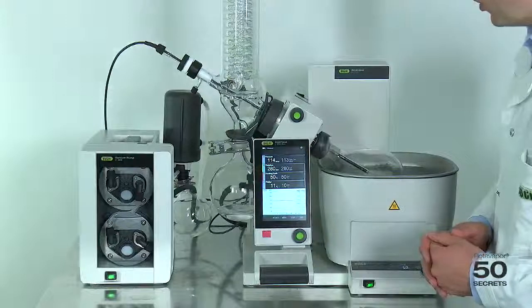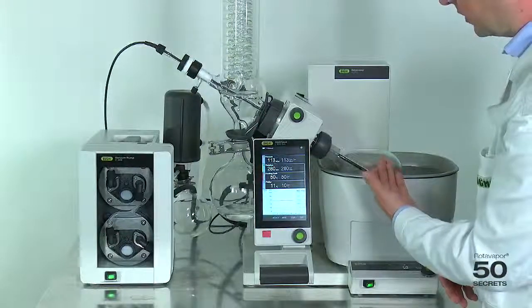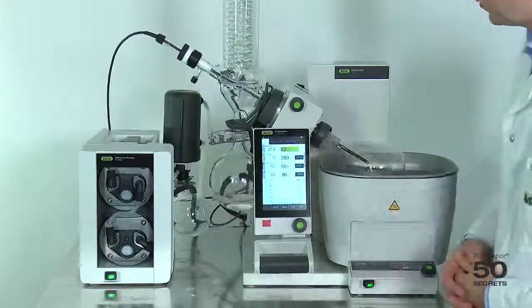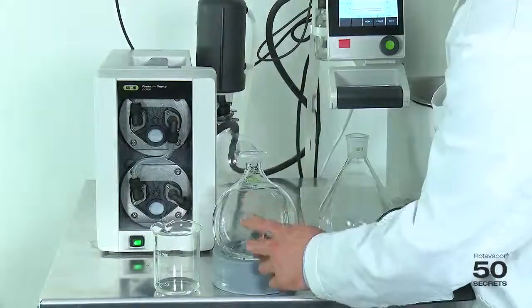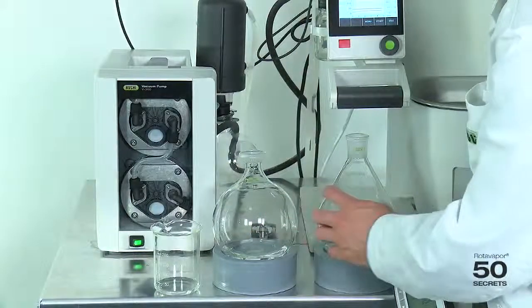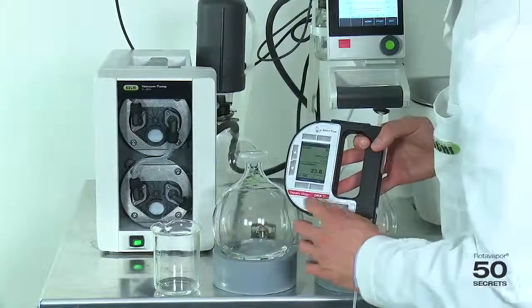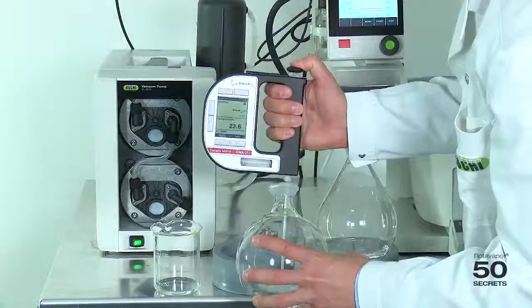Now let's end this process in the middle in order to find out what the percentage of alcohol is in this side and what percentage is on this side. After the distillation, we have the solvent in the receiving flask and some solvent in the evaporating flask. We've tried to split it up in half, so now I would like to measure the density and therefore the alcoholic content. Let's first start with the receiving flask.